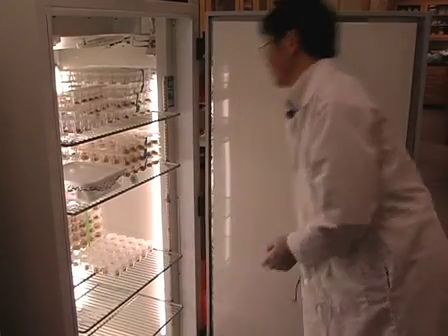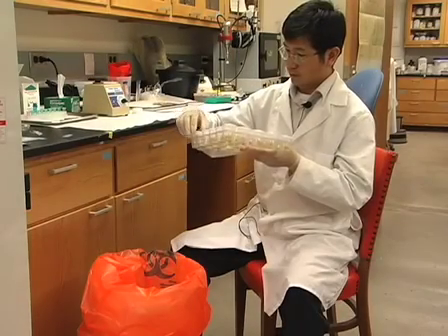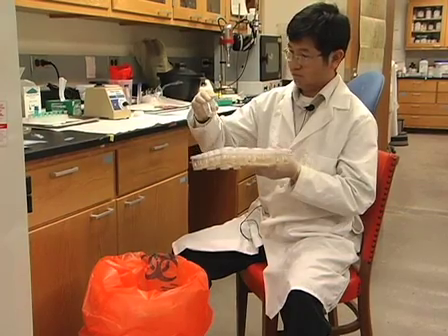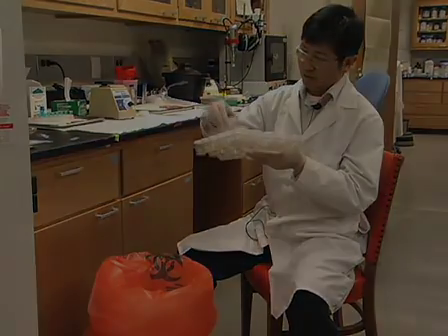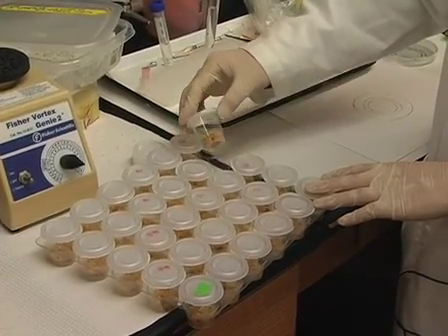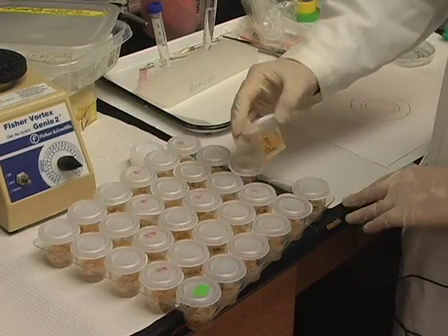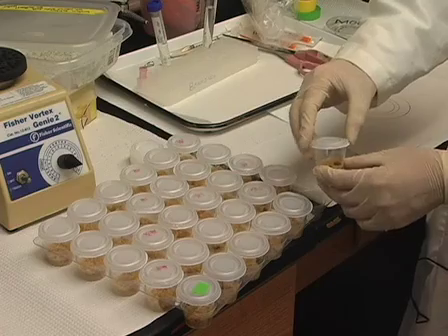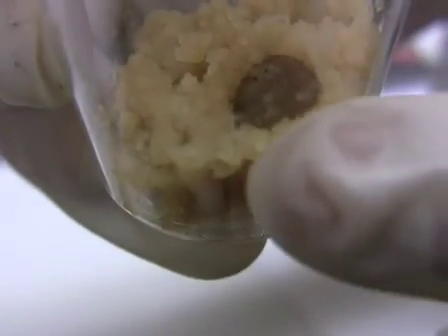After transferring the larvae, cover the cups with lids and incubate at 28 degrees Celsius. 24 hours after infection, eliminate any cups containing dead larvae, as these early deaths likely result from handling injury. When using this bioassay to determine lethal dose, the larvae should be checked every 2 to 3 days until the mock-infected larvae and any surviving virus-treated larvae have pupated or have begun to burrow in order to pupate.